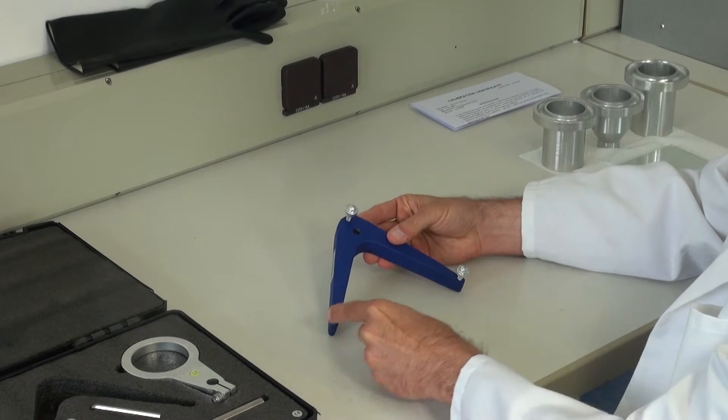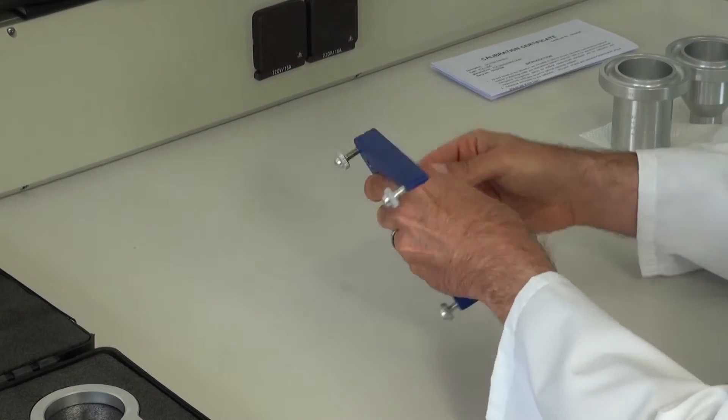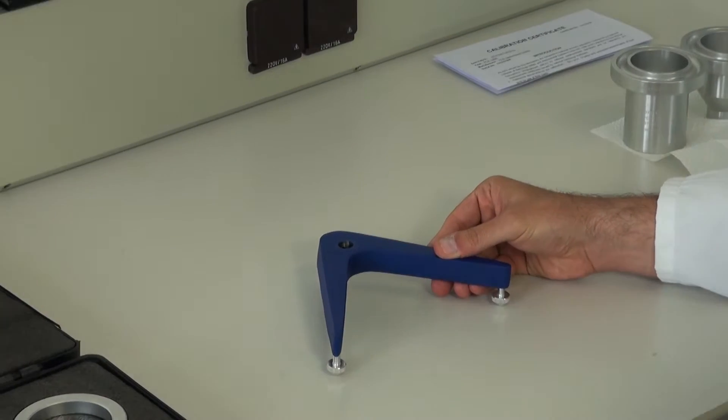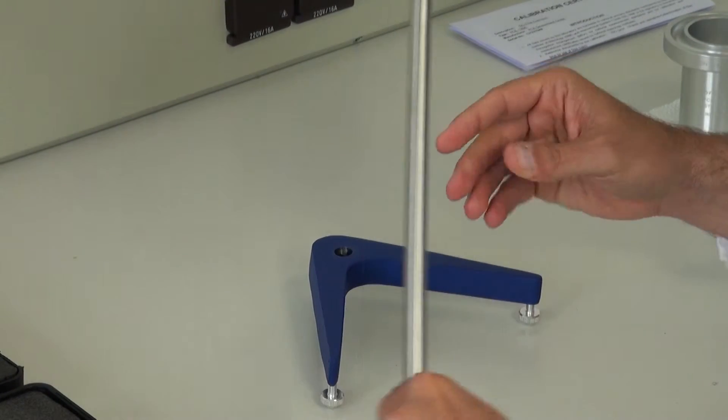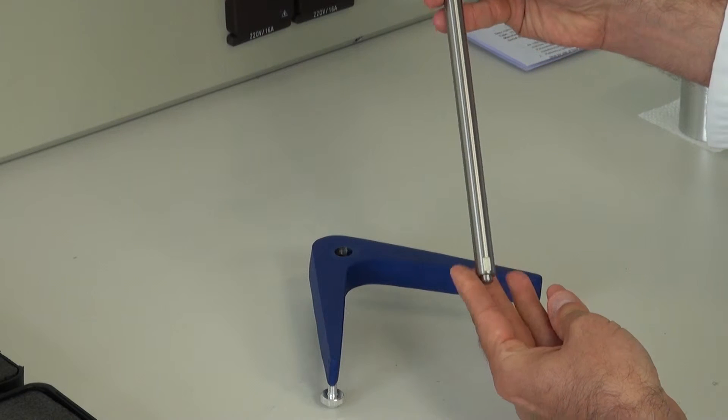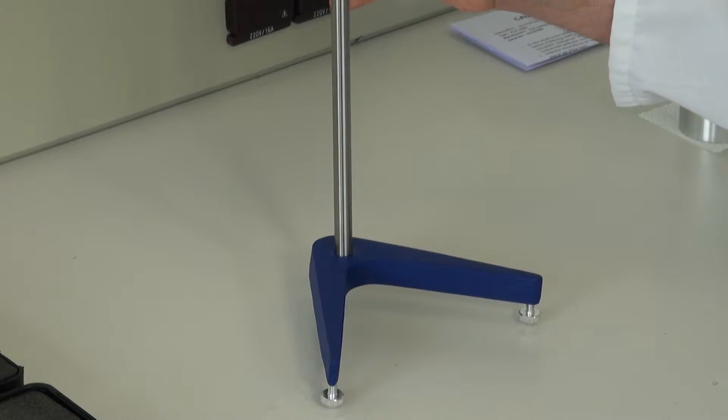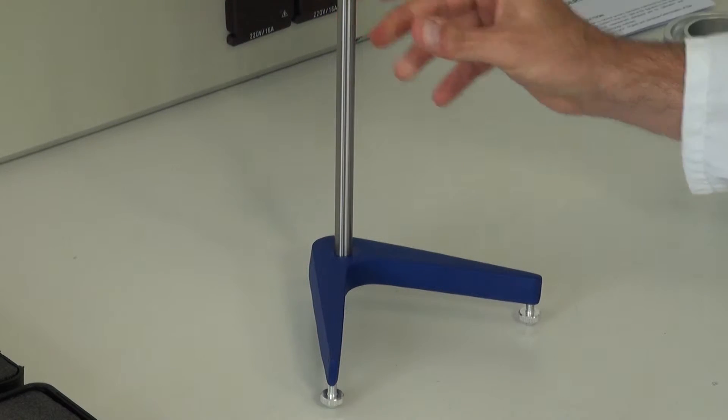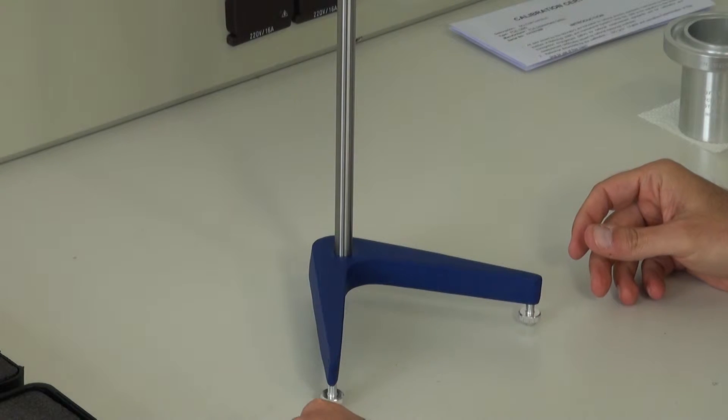The base stand has three turnable feet. Then the stand rod is inserted and fixed with an allen key.